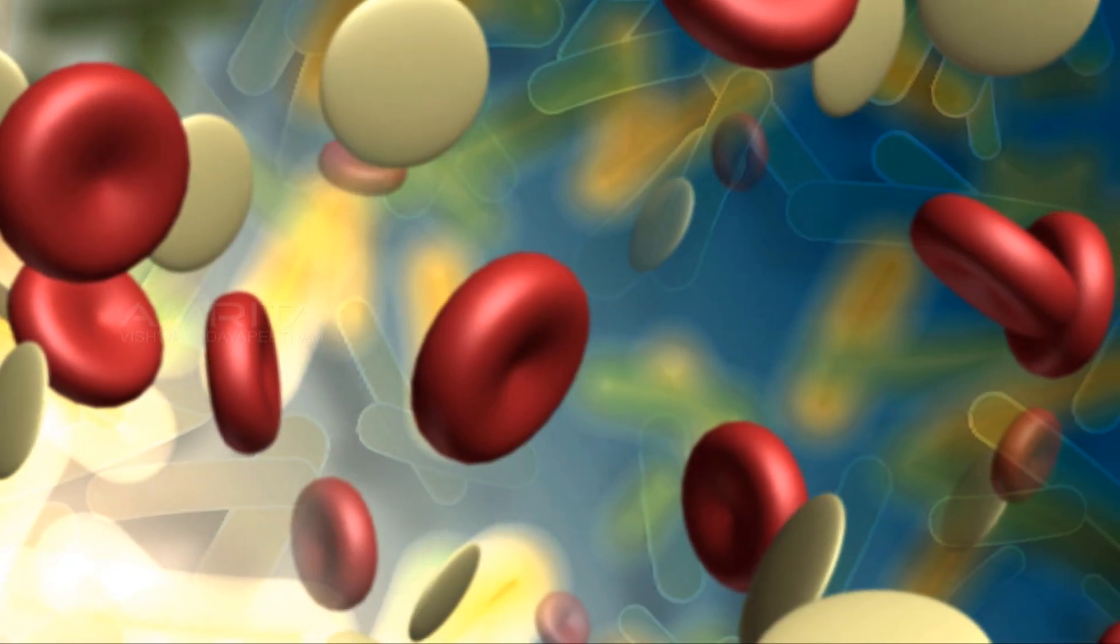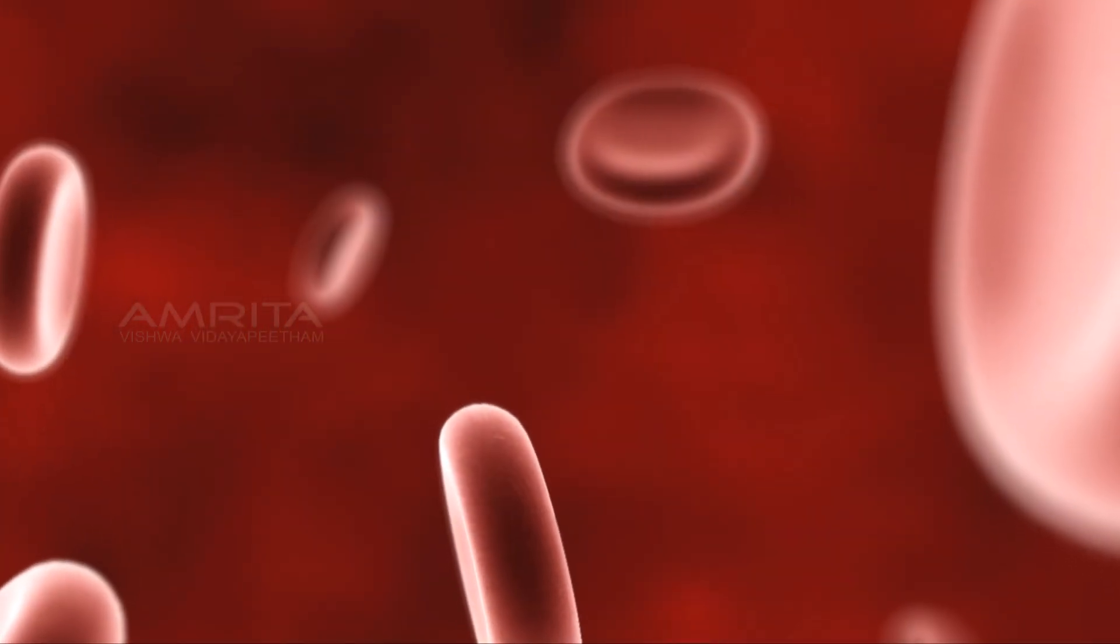Different kinds of cells can be counted separately as long as they are visually distinguishable.